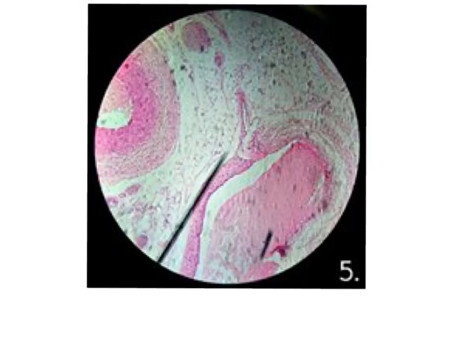This is the third structure in this group of hollow organs, but actually it is formed of 2 structures coming together, which are the medium-sized artery and medium-sized vein. And in between we have an areolar connective tissue. The medium-sized artery is the one with the thick wall and narrow lumen, and the medium-sized vein is the one with the thin wall and wide lumen.